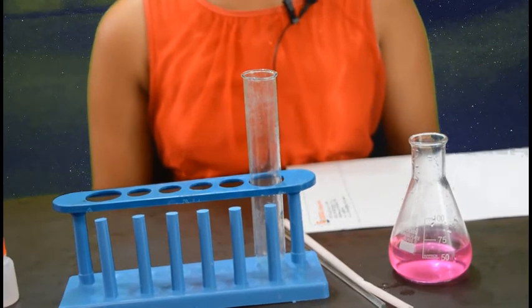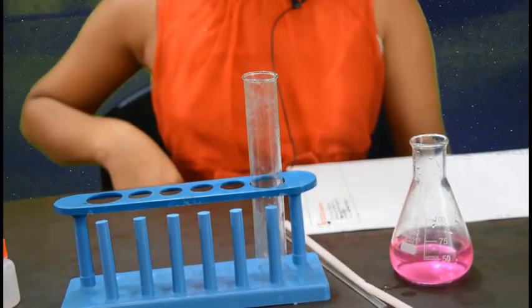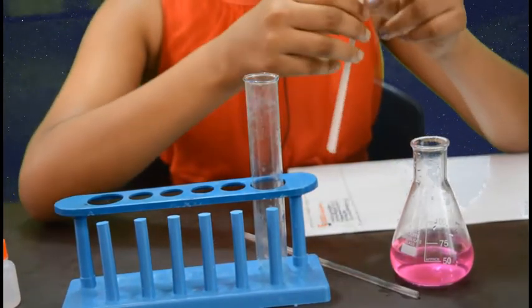Now let's see what happens when we blow air into the sodium carbonate solution.